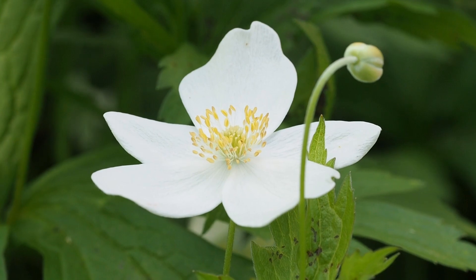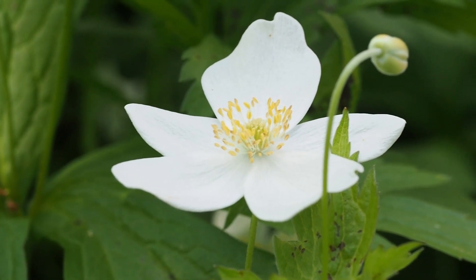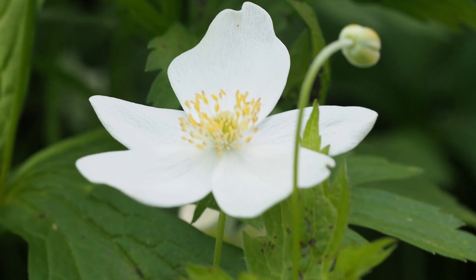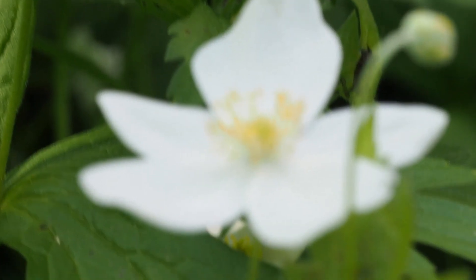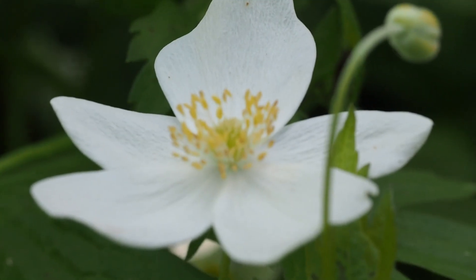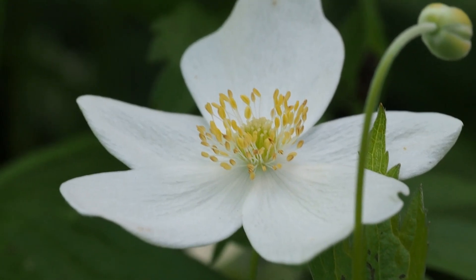Typical member of the Ranunculaceae. What we see are five — are they petals? Are they sepals? We'll try to figure that out. And many stamens and many carpels.